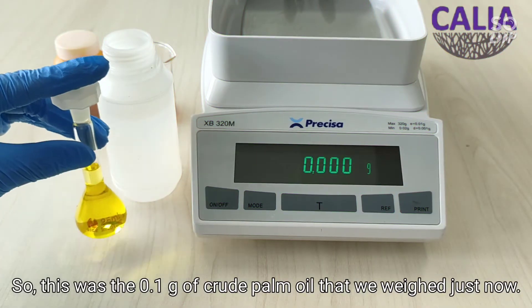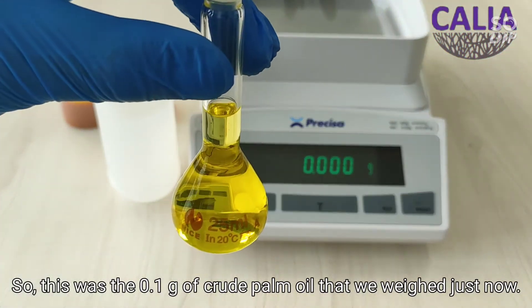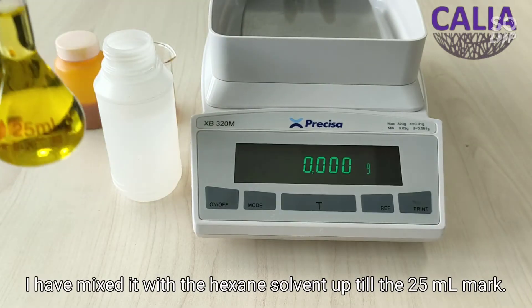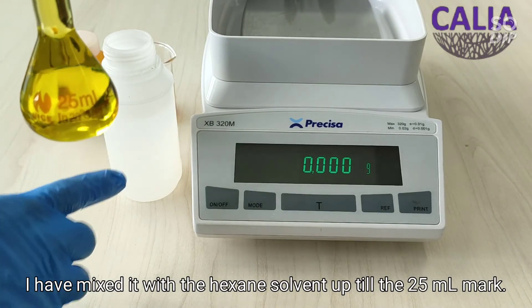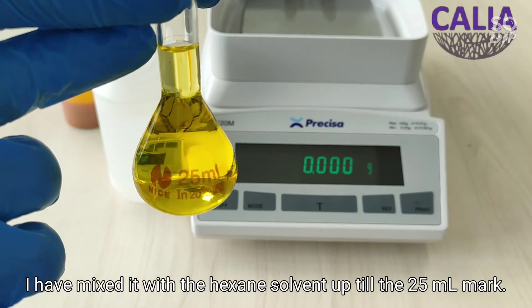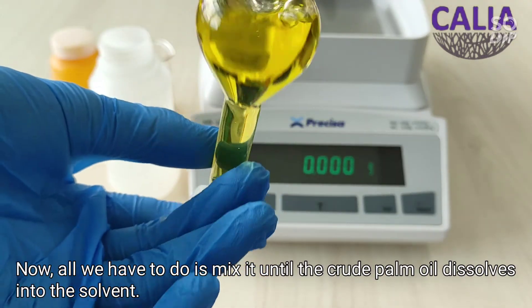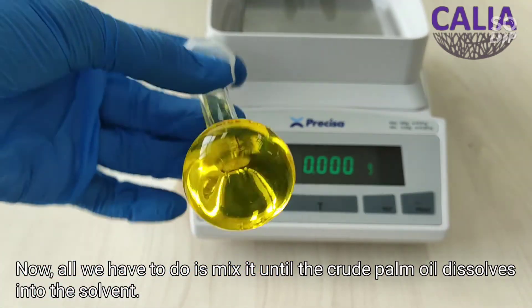So this was the 0.1 gram of crude palm oil that we weighed just now. I have mixed it with the hexane solvent up till the 25 milliliter mark. Now all we have to do is mix it until the crude palm oil dissolves into the solvent.